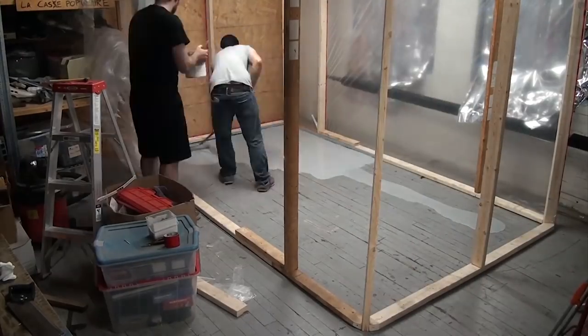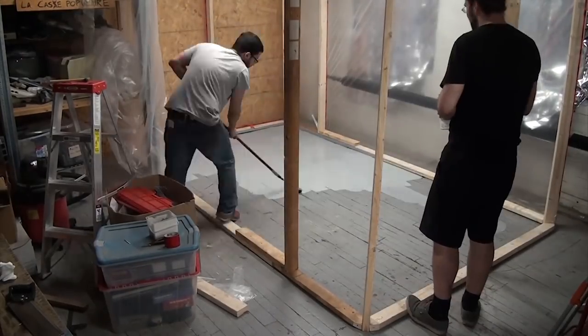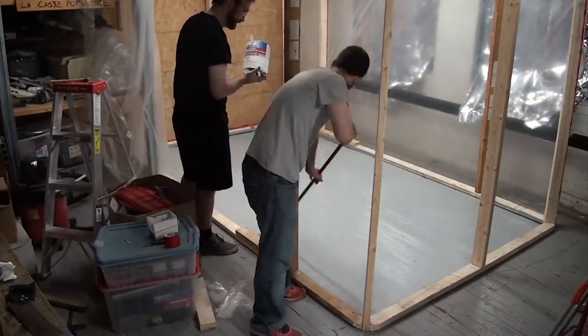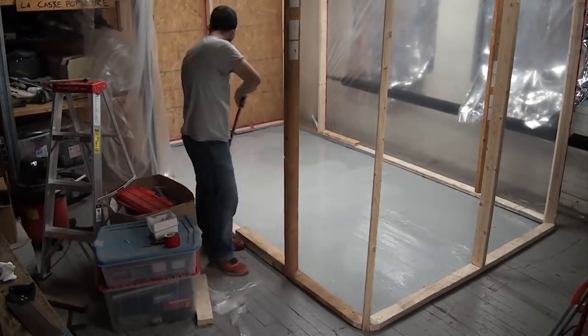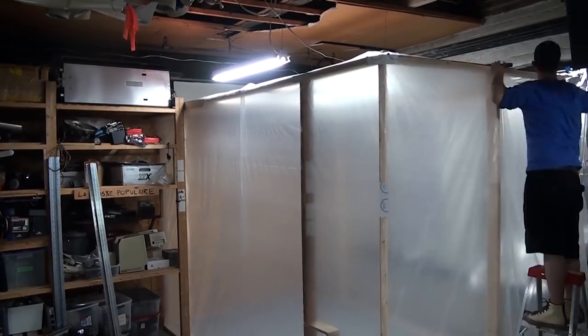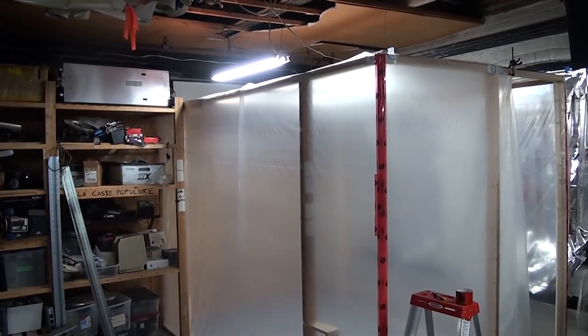Before we can start work on the inside and finish off the outside walls, we need to do something about the floor. It was full of holes and we didn't want things coming up from below, so we got a floor epoxy kit and covered everything in a nice thick layer and let it cure overnight. The next day, once the floor was cured, we finished the outside plastic layer, but left a hole so that we could still get inside.